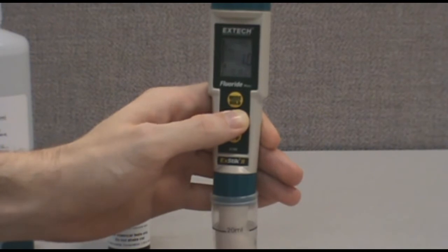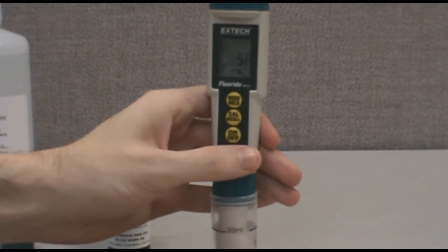When the display shows 1.0, release the calibration key. The screen will display SA. At this point, the calibration is complete.